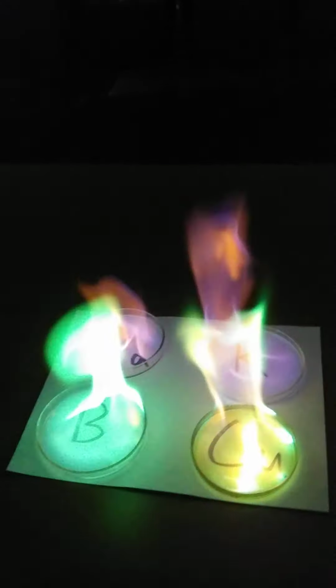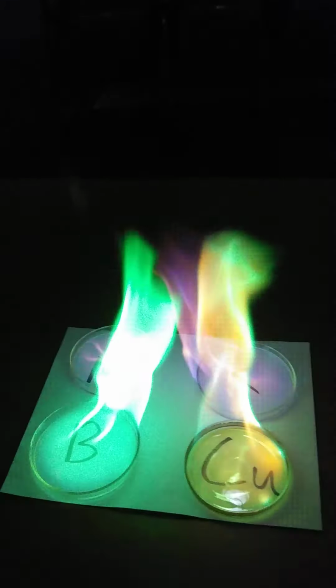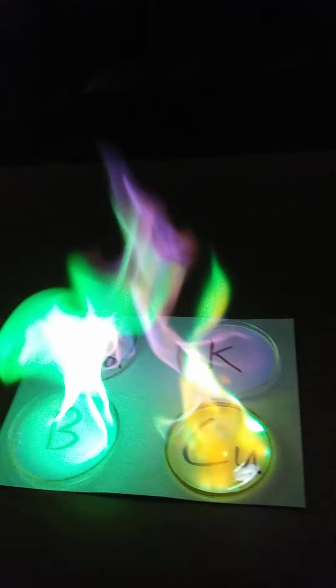All right, but anyway, here's the idea, the chemistry we're learning. These different elements, oh, it's getting toasty. These different elements are emitting different colors of light when we're burning them in this flame. And we can use those different colors of light to actually identify the element. There's instruments where you can do that.